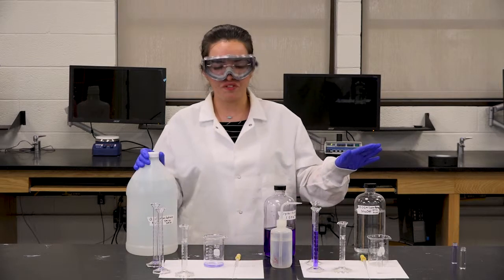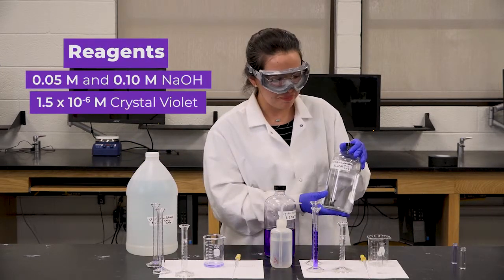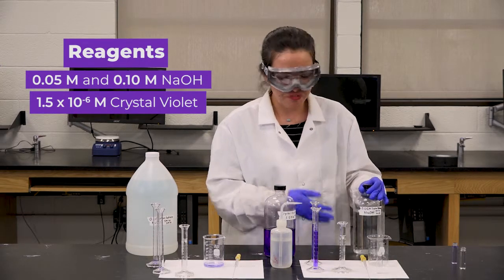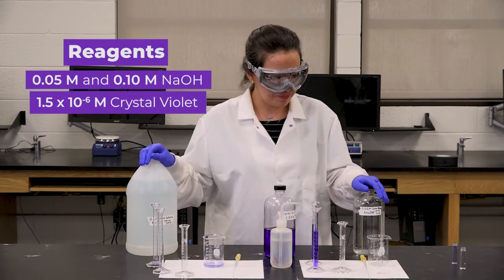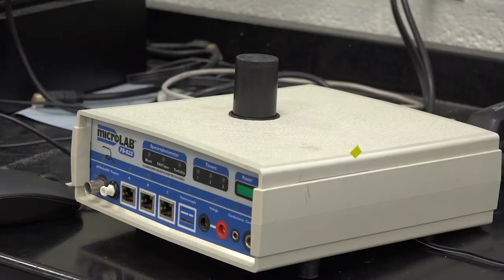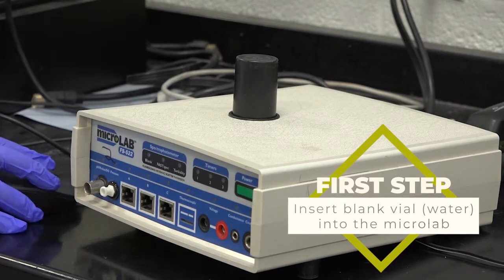So now that I already have my first solution prepared, I'm gonna switch gears to working with the second solution. And this time I'm gonna use 0.05 molar sodium hydroxide. And it's very important for us to look at the labels, because even though it's the same chemical, we're using different concentrations, and we don't want anything to be mixed up or cross-contaminate. So our next step will be to place the vial with the water inside the spectrophotometer.